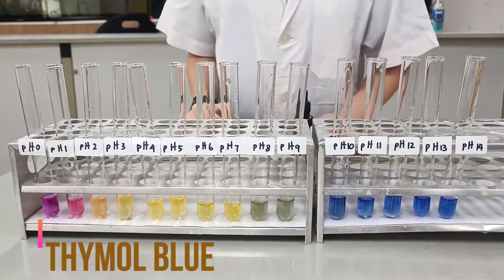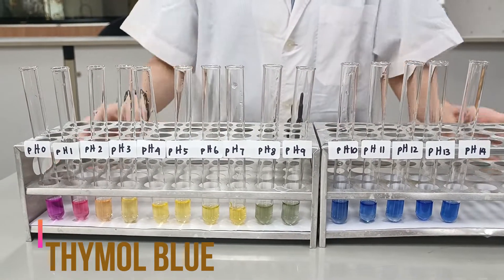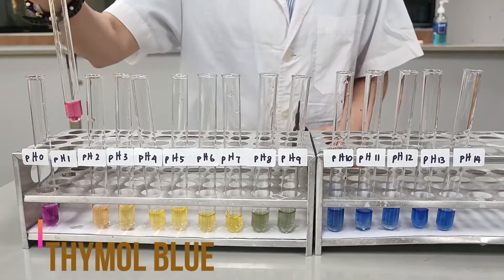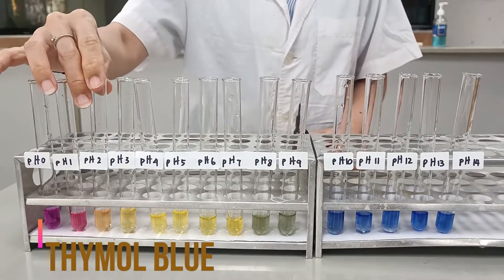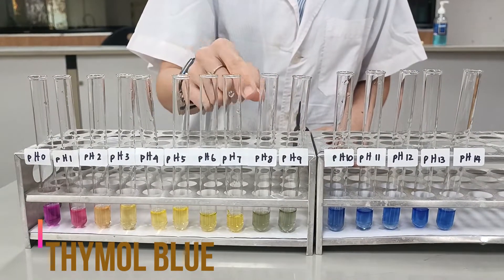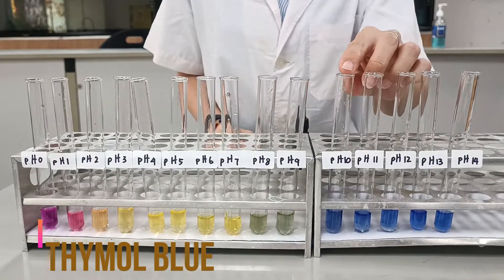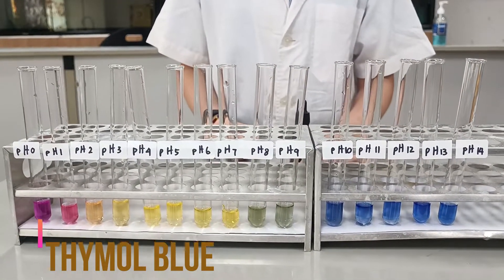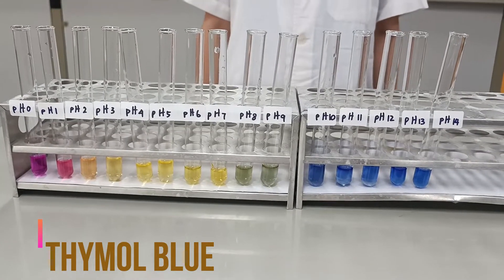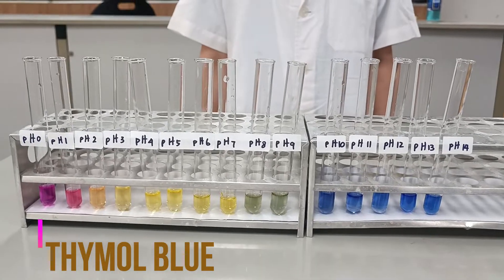We can see that thymol blue has several colors. It starts with pink, then followed by red, orange, yellow, and it turns green at around pH 8 and continues to give blue colors at around pH 10. Thymol blue is actually a component that is used in universal indicator.